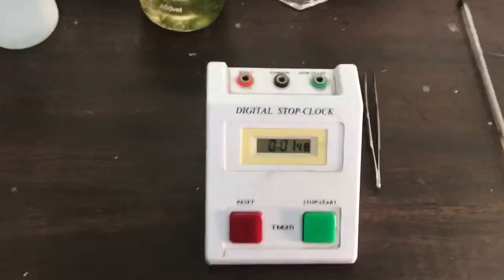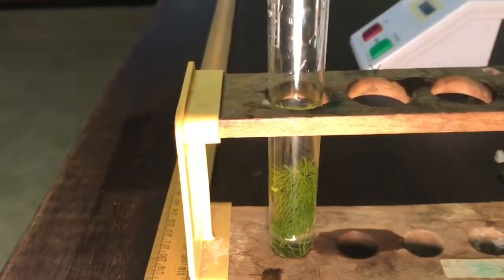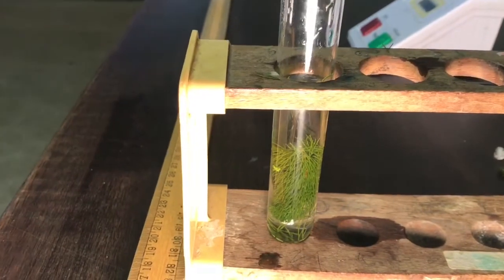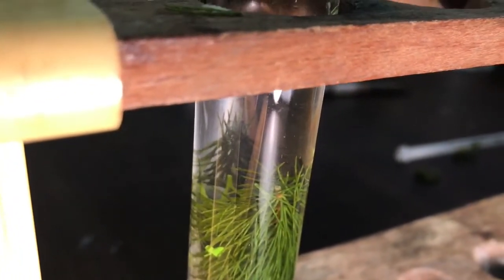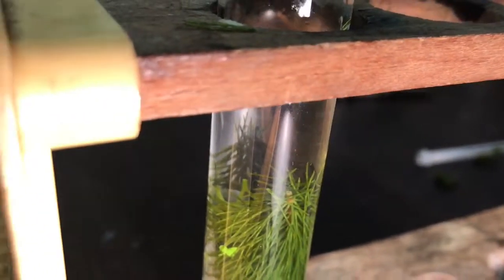And take a measurement of bubbles. I'll calculate a mean working out over three different sets of results if I have the time, hopefully you do. And we can then measure a little bit more accurately because we know the more that we measure the mean, the more accurate the results.